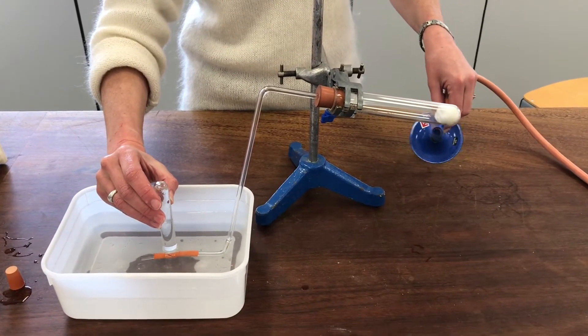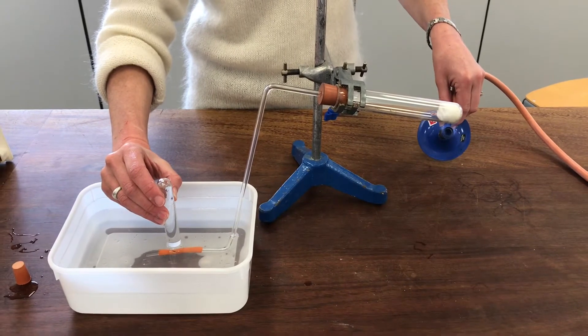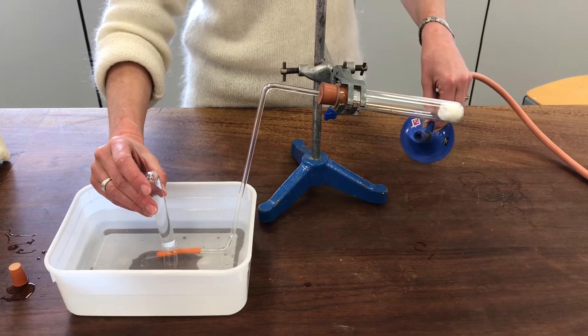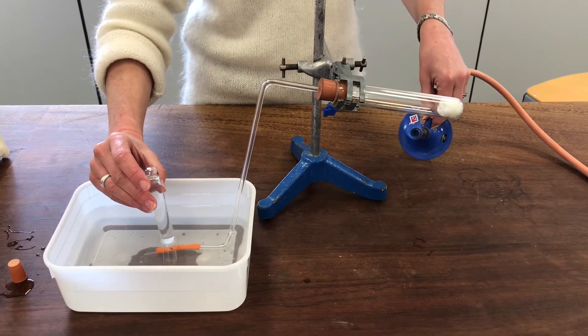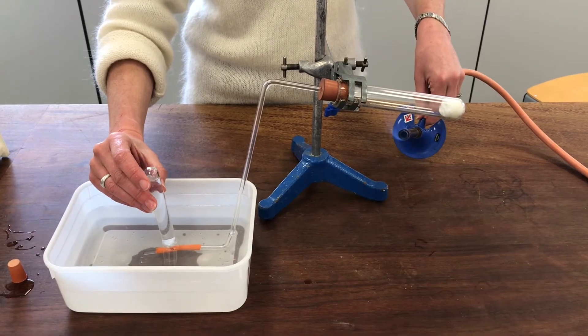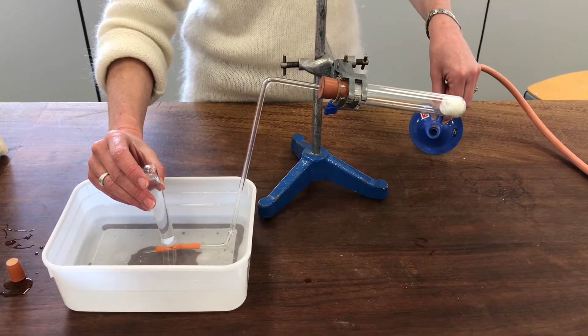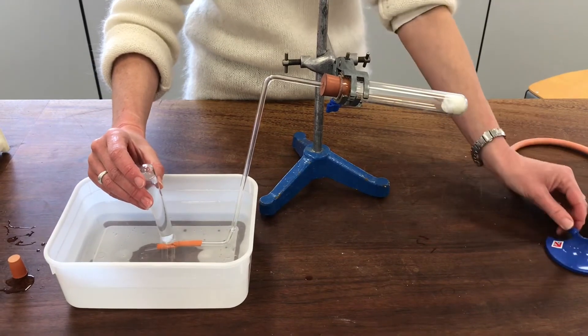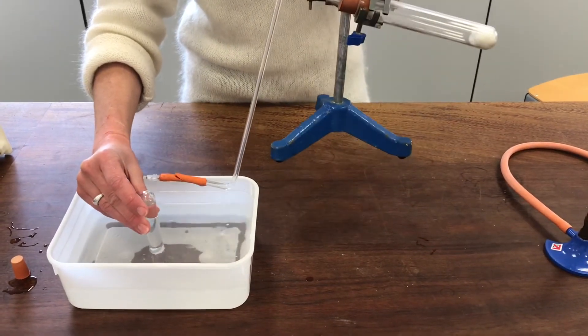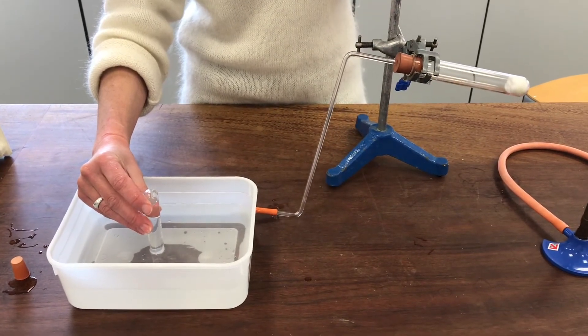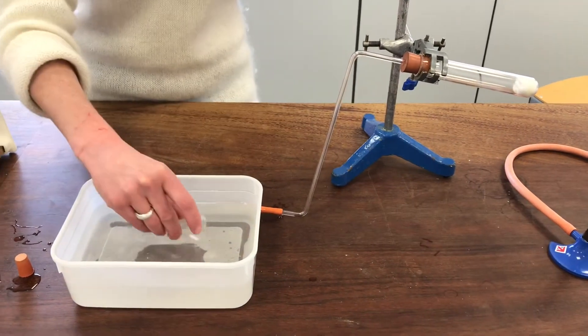I might not manage a third one. No, I don't think we've got enough for a third one. I'm going to just stop heating and lift this completely out of the water to stop any water sucking back into my hot boiling tube as it cools down.